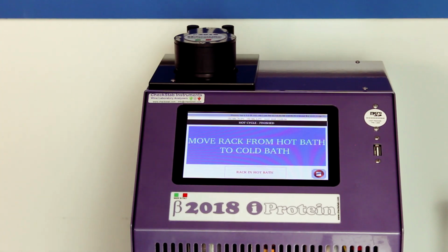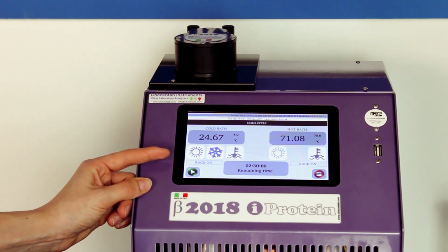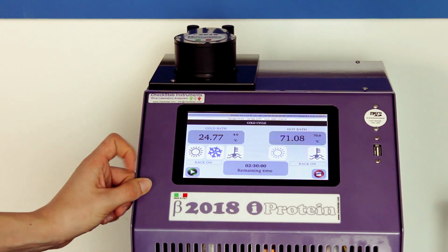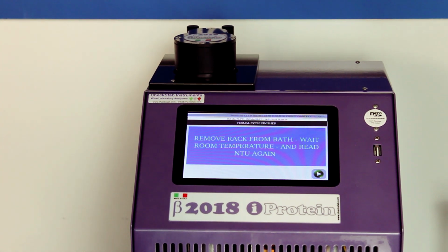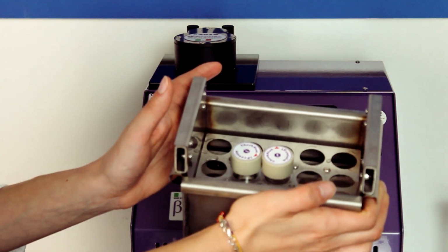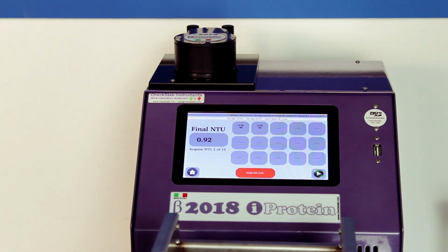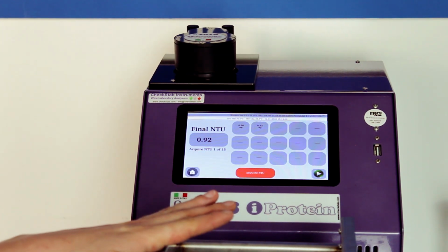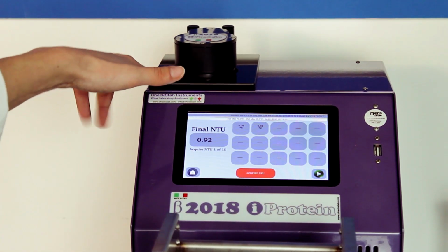Once the hot cycle is finished, a warning appears inviting the operator to move the basket from the hot bath to the cold bath. Once the basket is moved to the cold bath, the countdown starts again. At the end of the cycle, the instrument will warn the operator that he has to move the basket with the samples into the resting pan. This is the resting pan, previously filled with room temperature water and alcohol. The alcohol helps to eliminate the glycol from the surface of our test tubes, and the sample must be at room temperature to do the reading of T2 to avoid condensation inside the nephelometric cell.